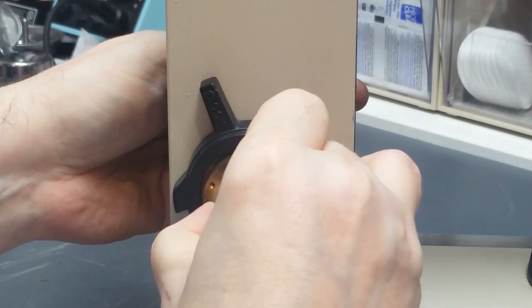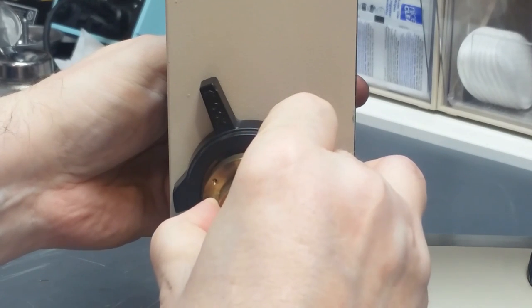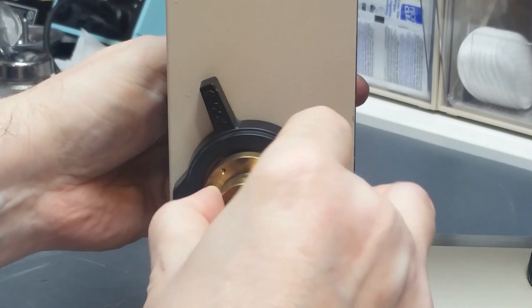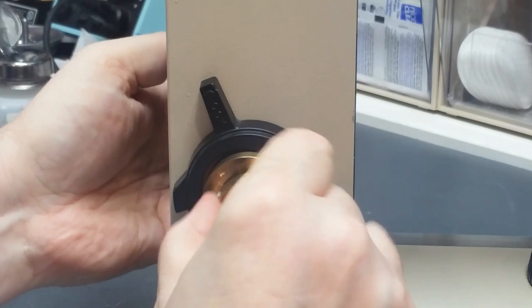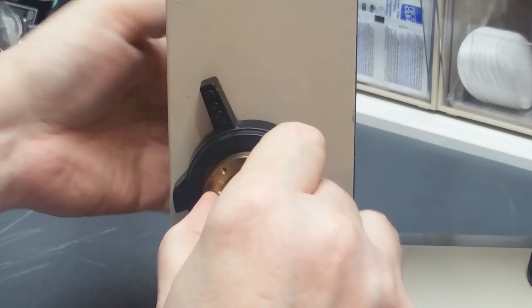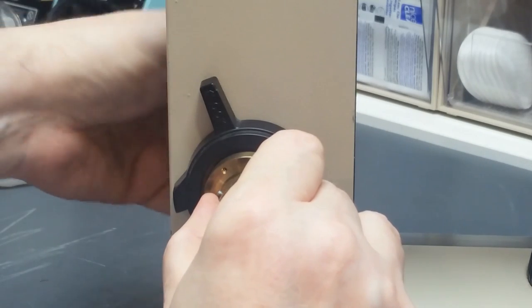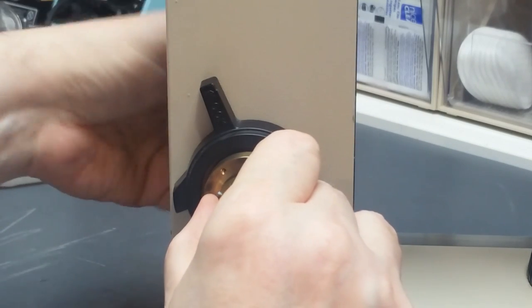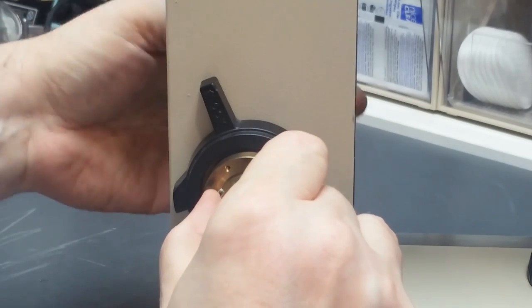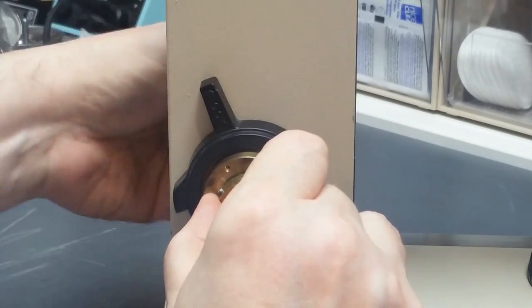Once that happens, I want to very carefully pull this out just enough so that the pins can cross each other and then push it back in. So now I'm on the other side of the pin. And once I've done that, I push the coarse focus knob on the back in this way, and start turning it so that this brass piece threads onto that rod that protrudes.